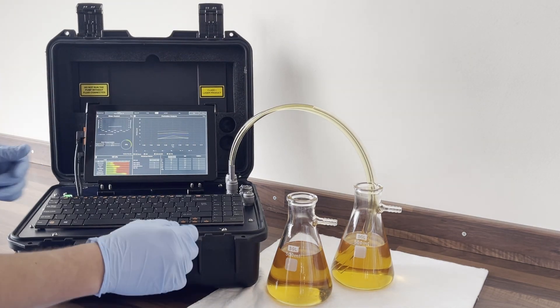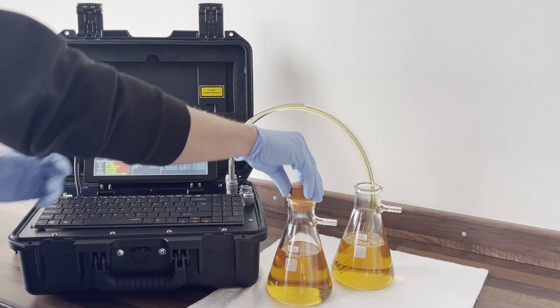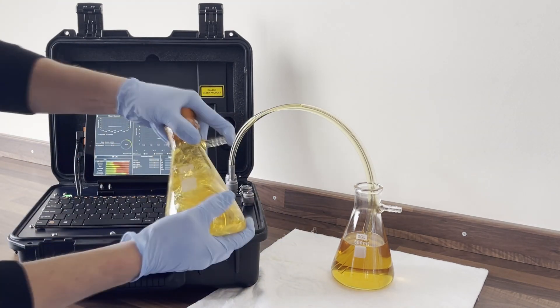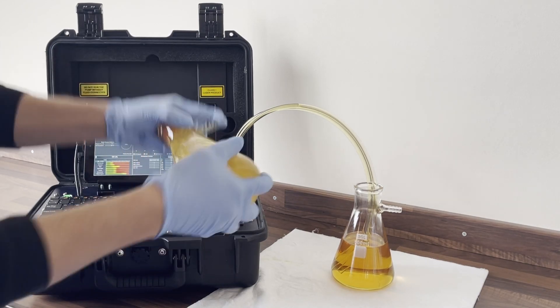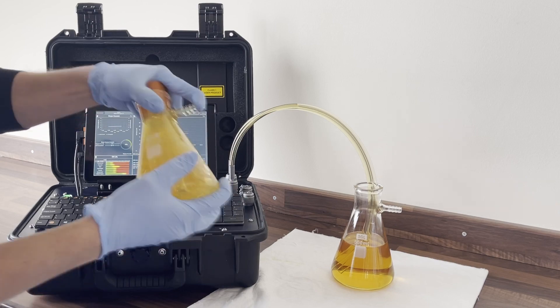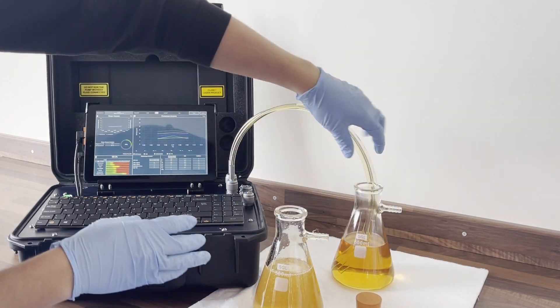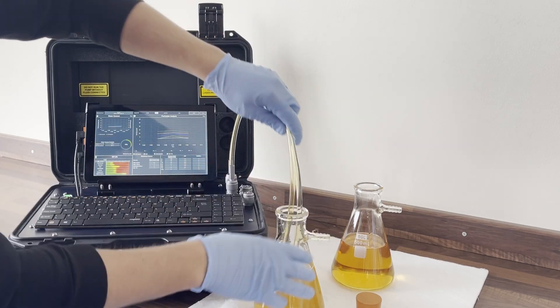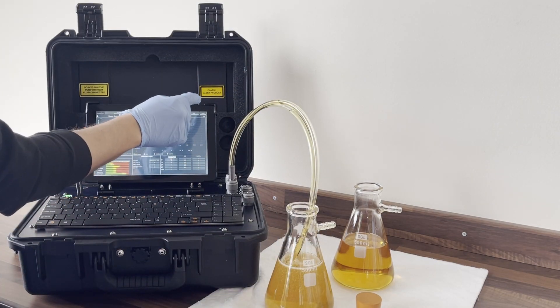Now we've completed our testing, we're going to stop the first test and aerate the second sample with the same oil in it. We're doing this to imitate what could potentially happen inside a hydraulic machine. We're going to change the hoses — it's the same oil so there's no cross contamination — and we're going to begin a new test.